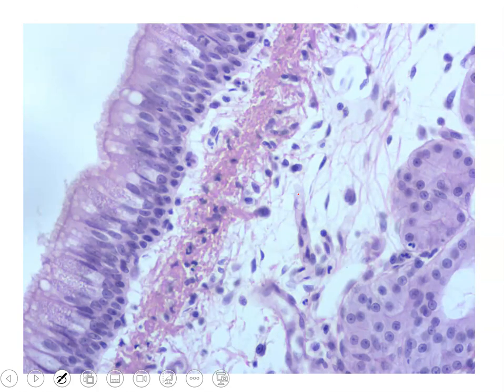Now, of course, we have an epithelium that might not appear like the other epithelium. Here is the apical surface. We know it opens up to a free lumen. Might look a little strange to you because it's on its side, but this type of epithelium is special because, as you can see, we have the nuclei at many different levels, giving off a fake stratified appearance.